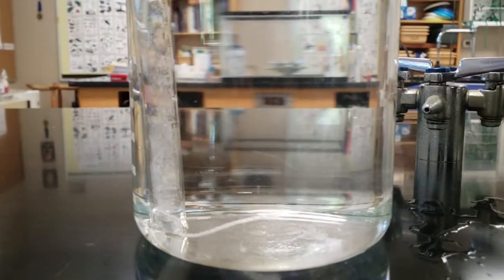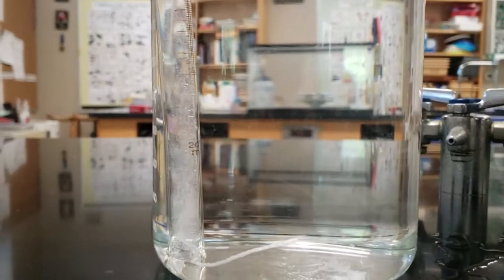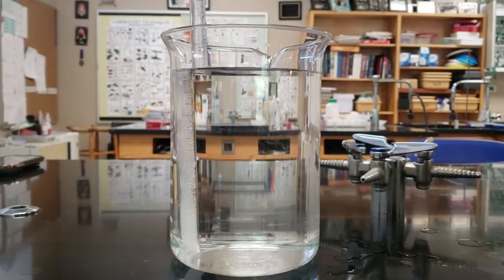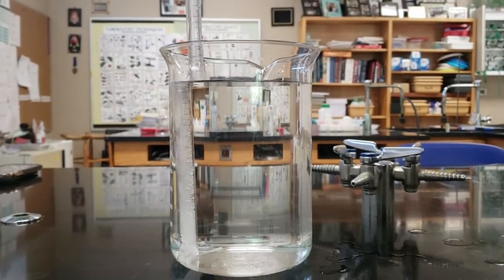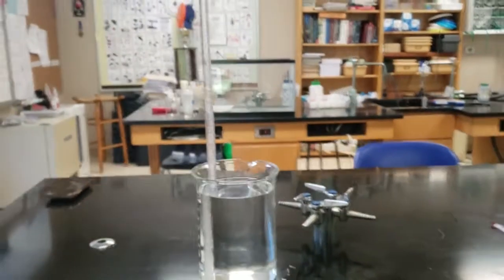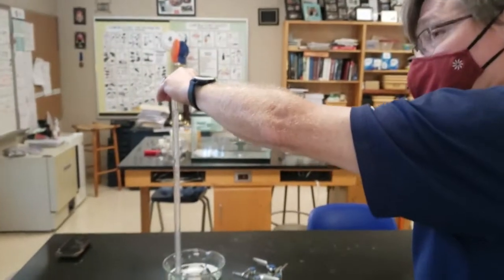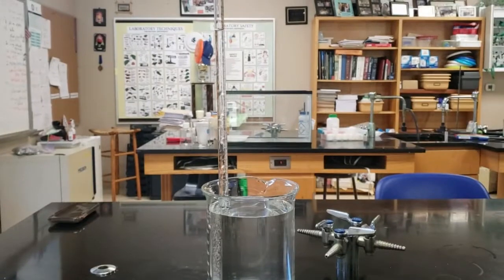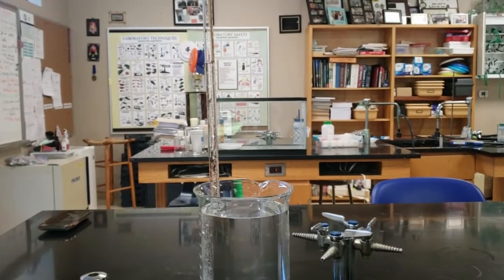You can see the gas bubbles being formed. Magnesium will react with acid to form hydrogen gas. So this is really flammable. We're collecting the gas in the tube. It starts off slowly and gets faster and faster. I'm holding it straight up, straight up vertical. I don't want the acid to pour out of the eudiometer tube.